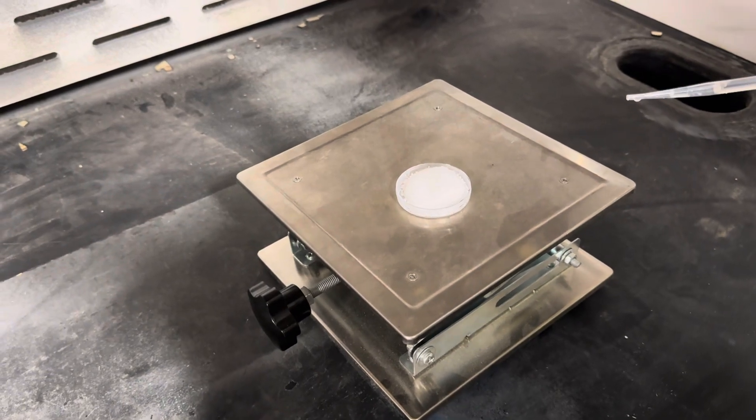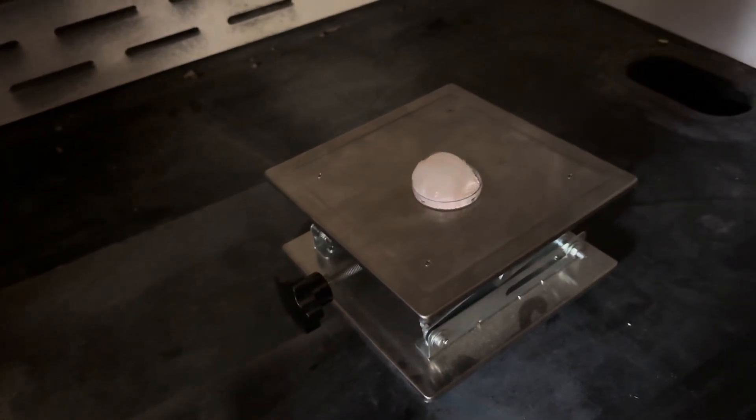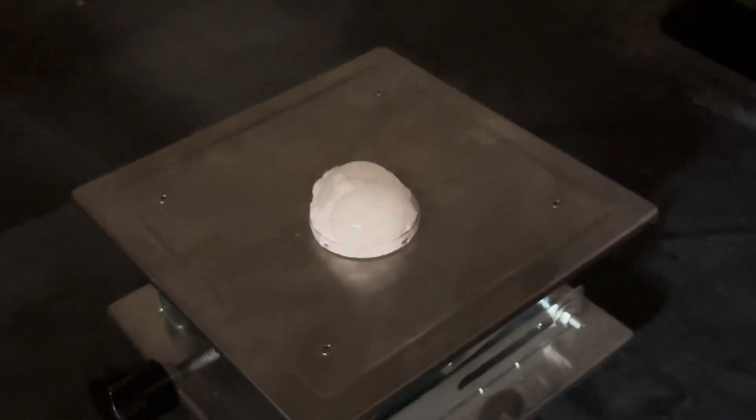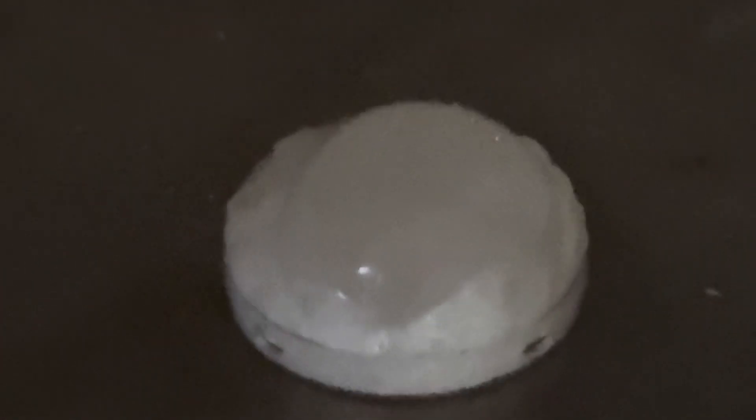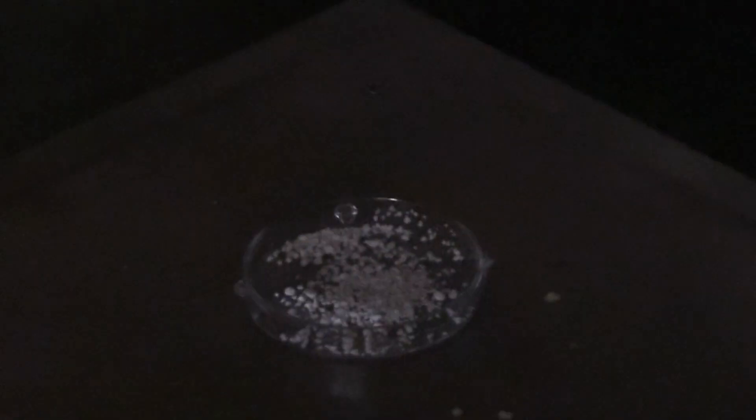I can't see anything. It's just bubbling right now. Maybe it'll turn red in a second. It's supposed to turn red. I think you need more of the peroxide. Okay. So less of the powder. Alright. Oh, there we go. There's a little red. Okay, it's very dull.